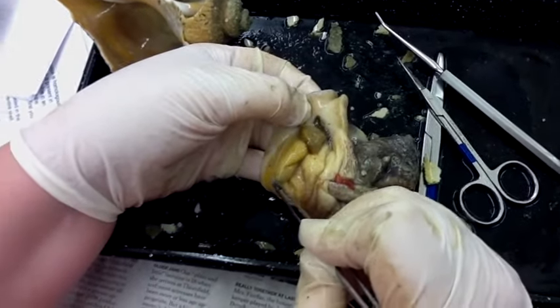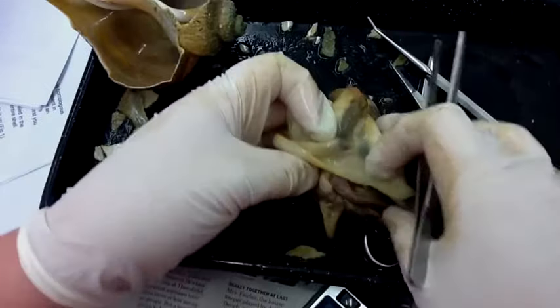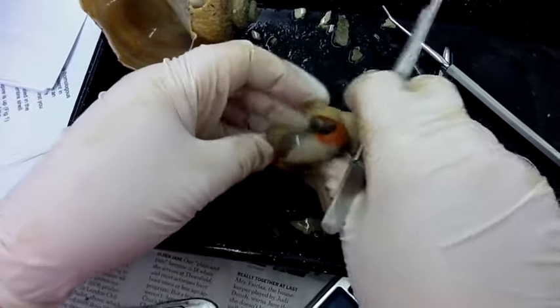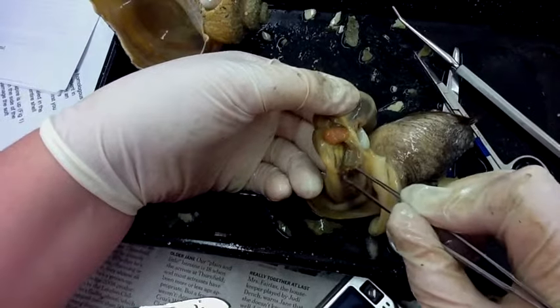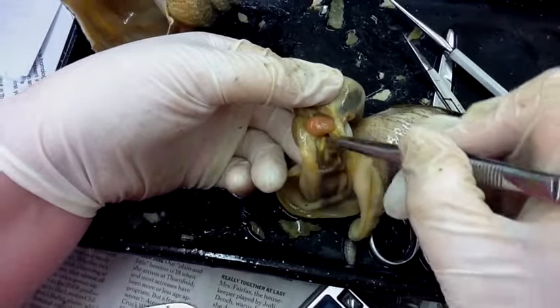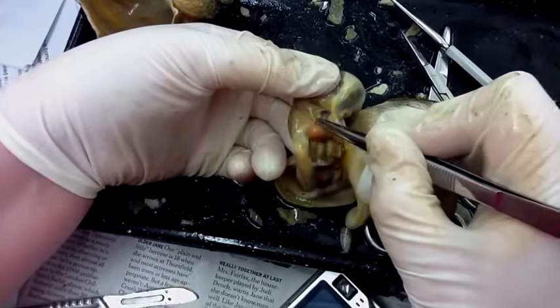Here is the anus of the animal, and we're going to go onto the visceral surface. On the visceral surface, here is the heart, and part of this is the digestive gland, and this is the nephridium here, which is part of the kidney, and here is the heart.